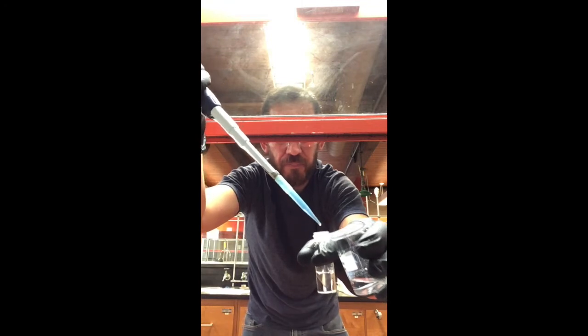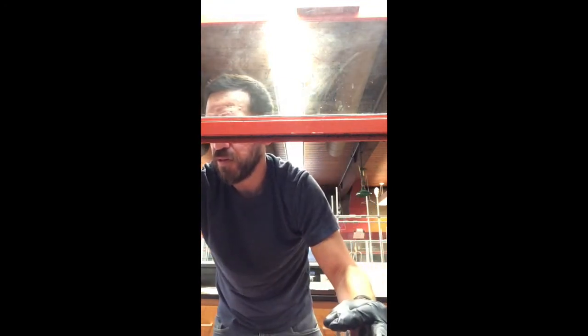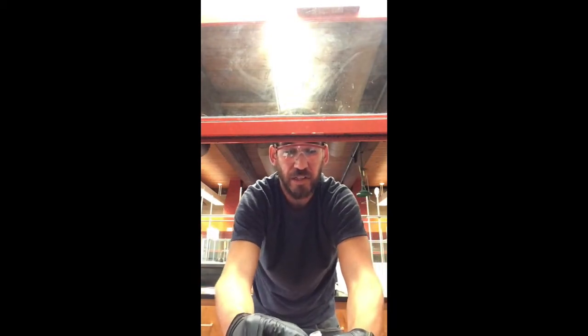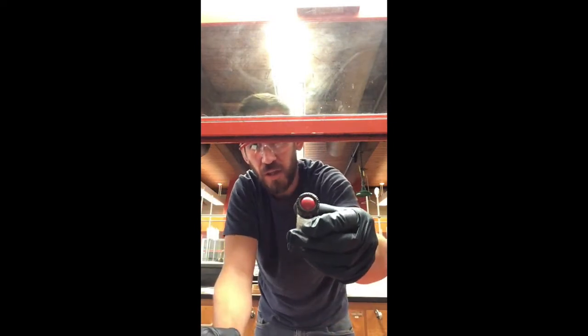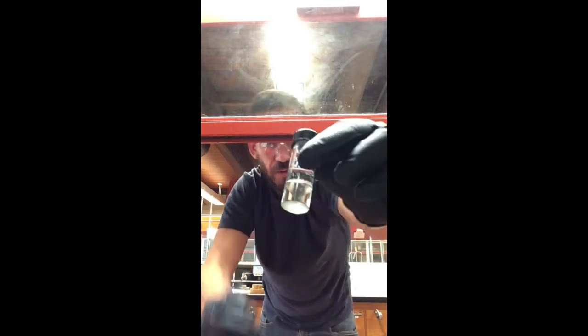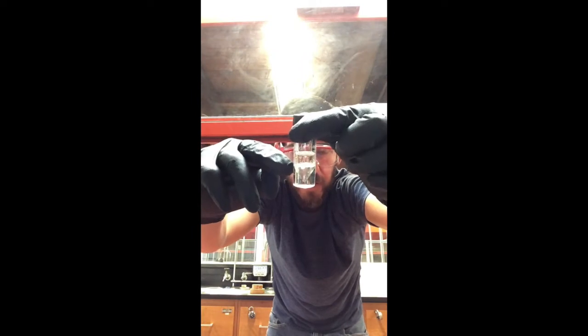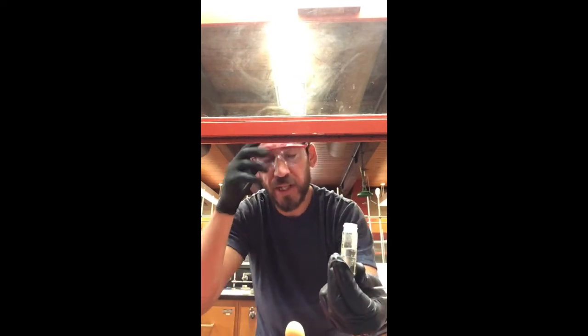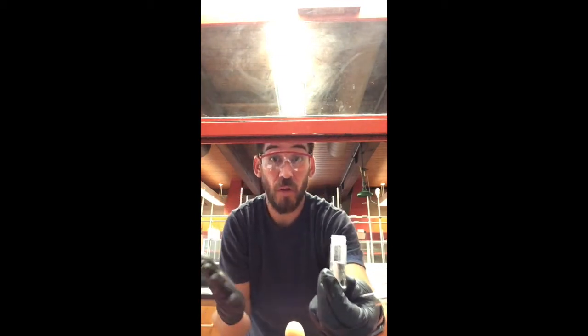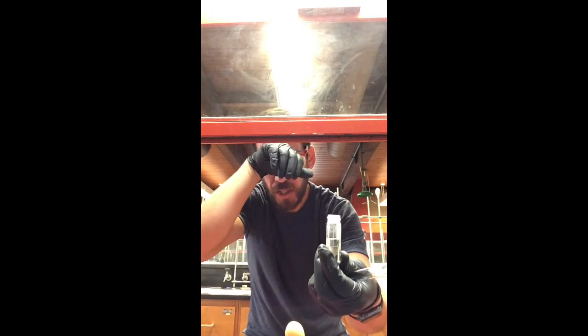Now we're going to do essentially the same thing as the caffeine extraction: cap the vial making sure the septum is covering the top really well, then shake it until the solid dissolves. You can see the two liquid layers at the liquid-liquid interface. Shake it for about a minute. After shaking and letting it settle, all of the solid has dissolved — good to go.